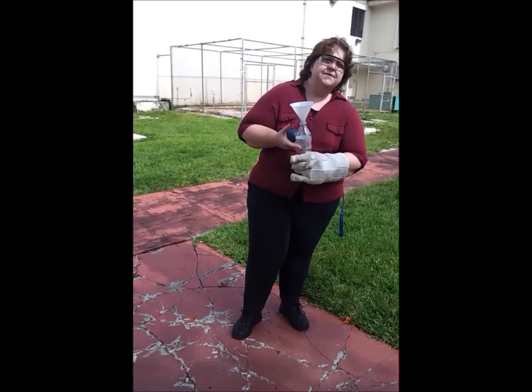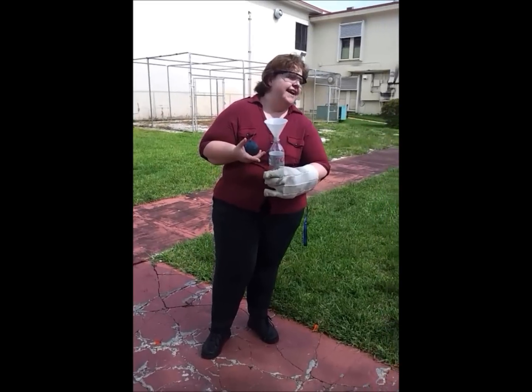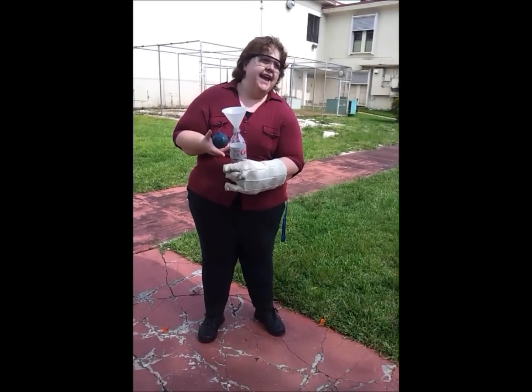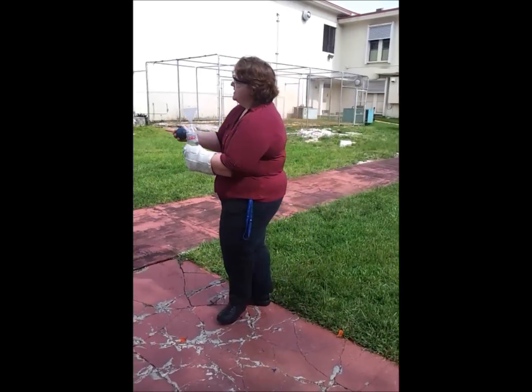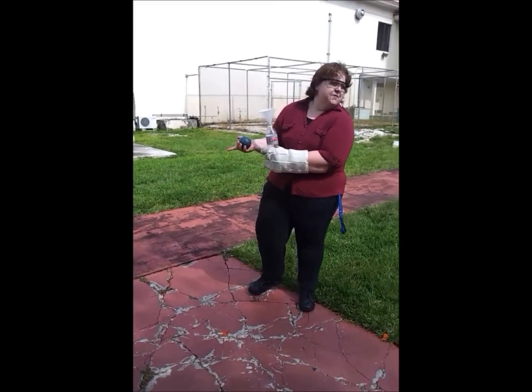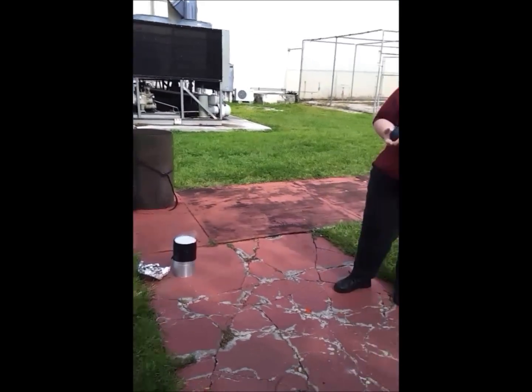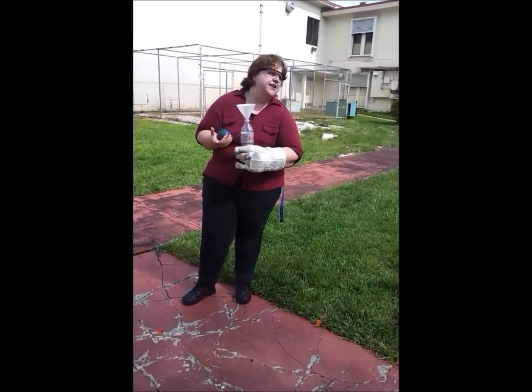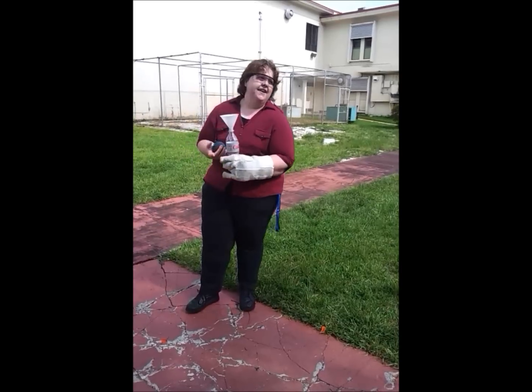It wants to increase its volume so much that it's going to explode right through the bottle. That's going to produce pressure-volume work. And as a result of that work, what we have here is a container half full of water — it's going to push the water up into the air. So you should hear an explosion and then see some water being pushed up into the air.